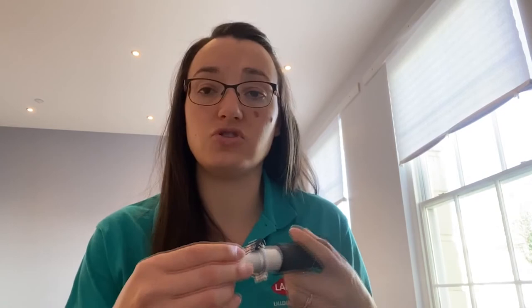What you need to do is walk into the field with your refractometer and a garlic press, get a sample of grass and squeeze some of the juice onto the front part of the refractometer, trying to avoid getting any foam in there if you can. You shut the front and then look through the little eyepiece and point the refractometer towards a light source — so the sun — and then you take what's called a Brix reading.